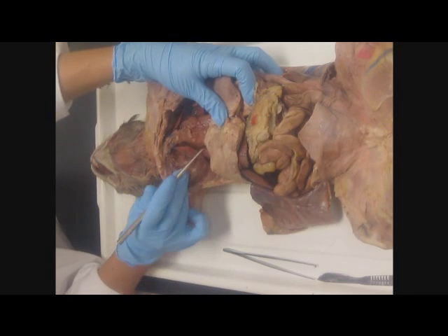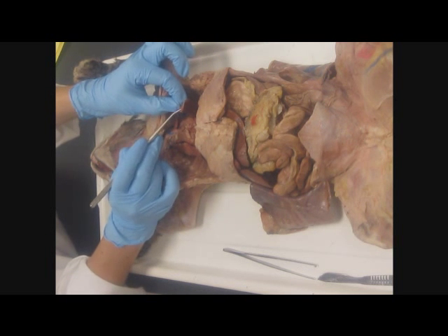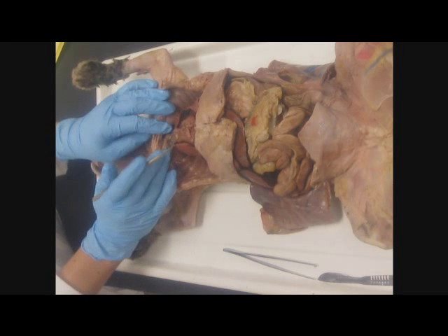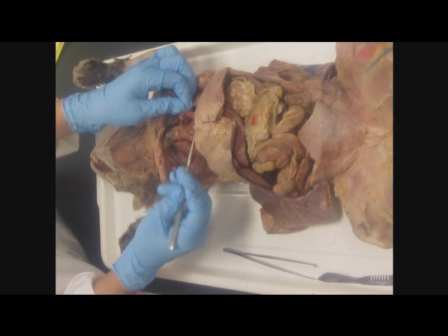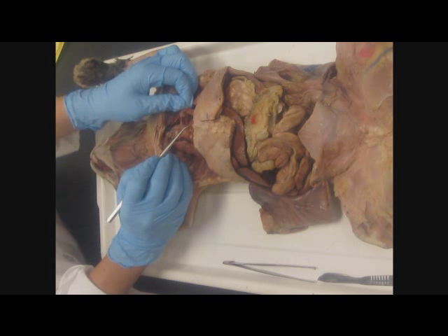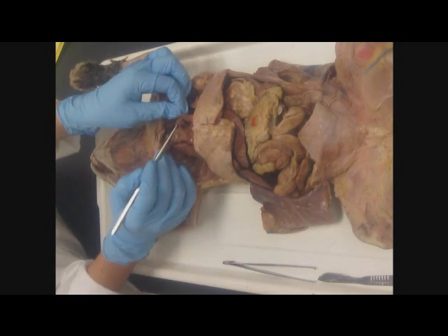So here's the lung on the other side. On the organ is the visceral pleura. Now we have the parietal pericardium and the visceral pericardium. So here's the heart. Okay, it's kind of got some of that goober stuff on there. Heart. On the heart will be visceral pericardium.